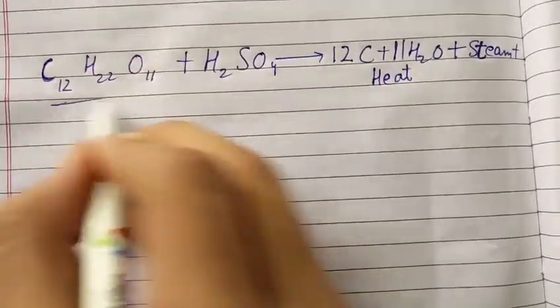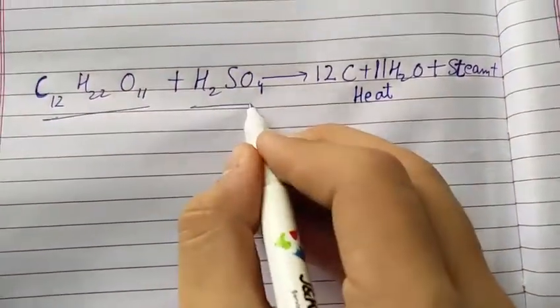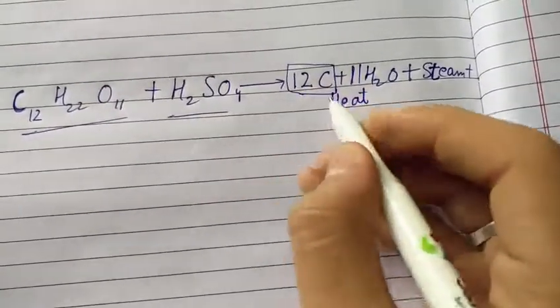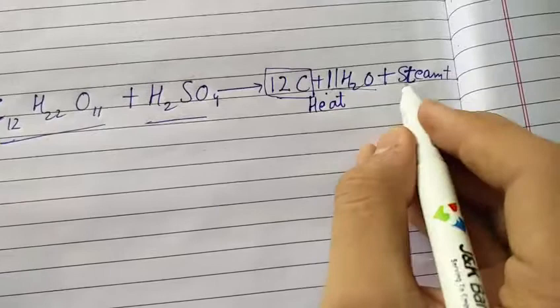I will write the whole reaction down when I reach home. I'll just keep it in the sink and pour some concentrated sulfuric acid on it.